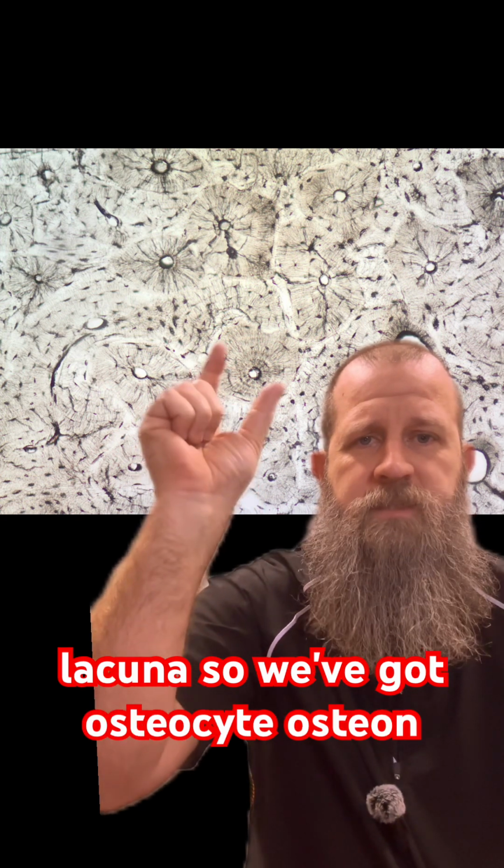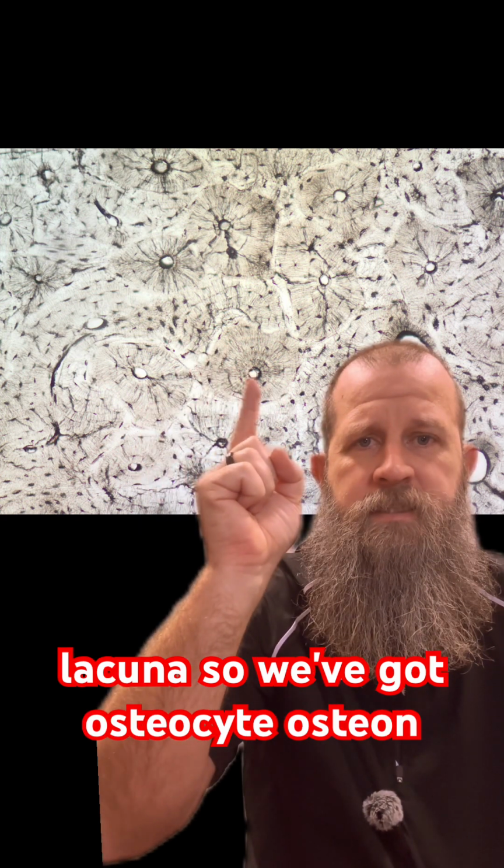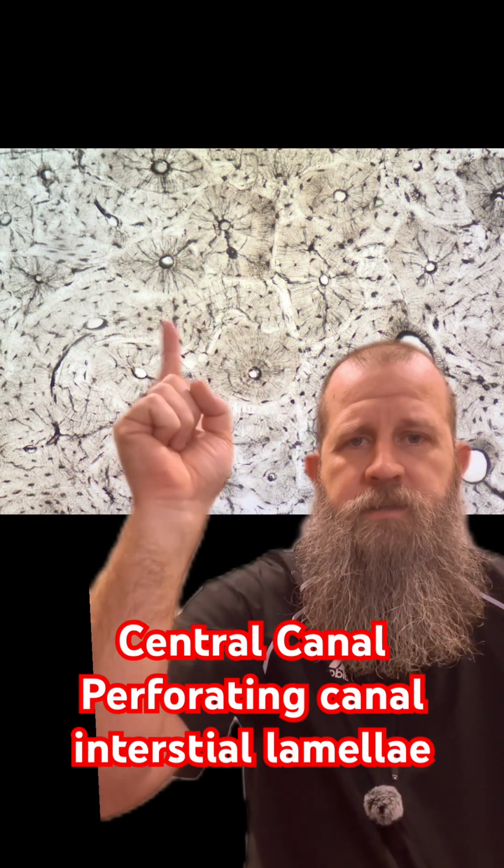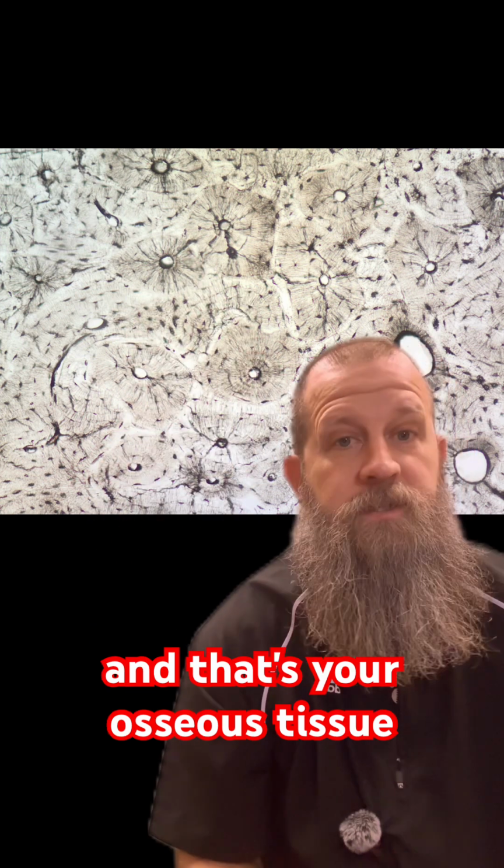So we've got osteocyte, osteon, central canal, perforating canal, interstitial lamellae. And that's your osseous tissue.